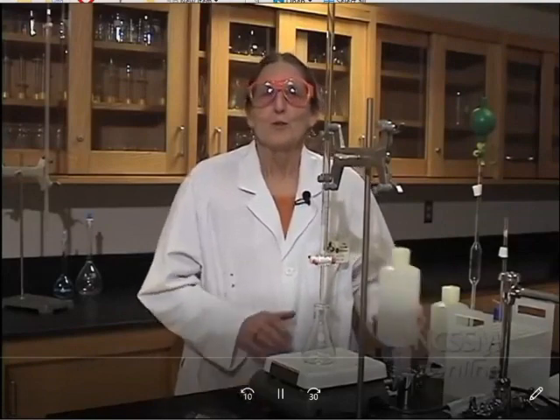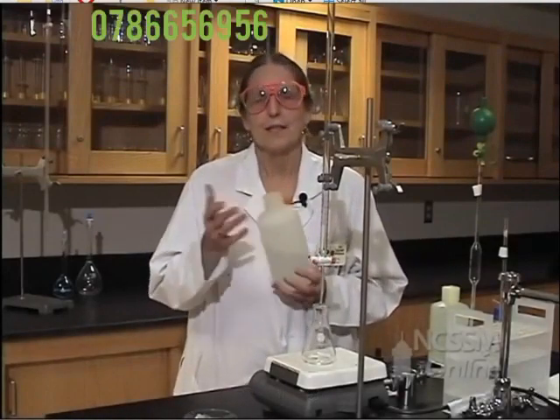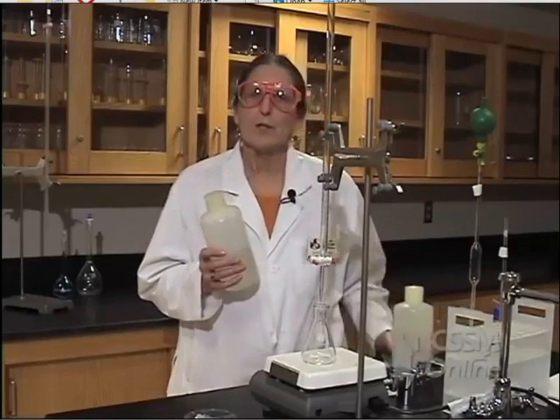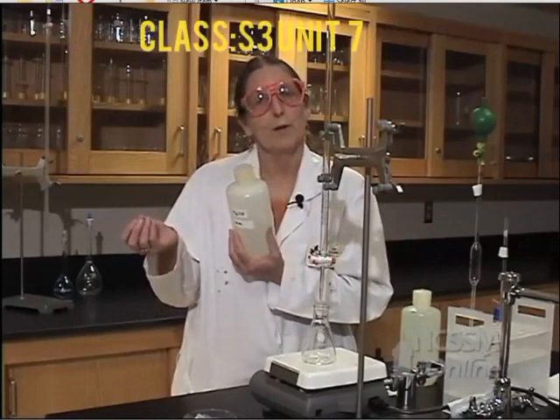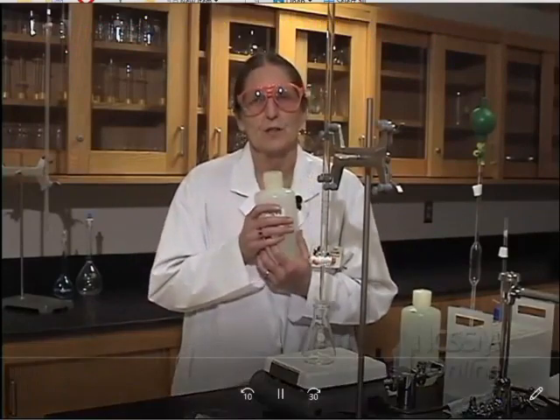We're now going to do a titration. A titration is a process that a chemist uses to determine the concentration of a solution. And the reason we do that is sometimes when you would think that if we weigh out a substance and find out how many moles of that, and putting in our volumetric, we would know exactly the concentration.